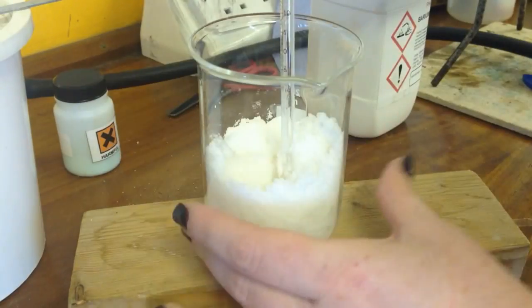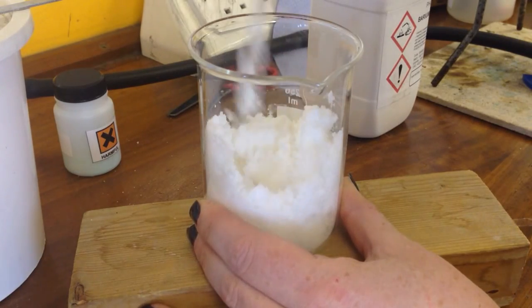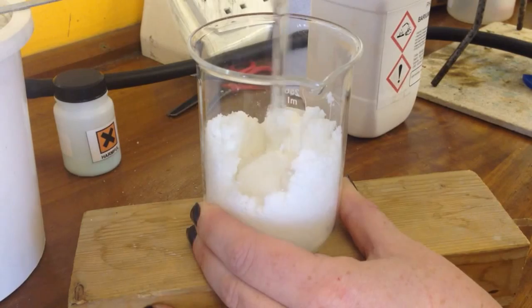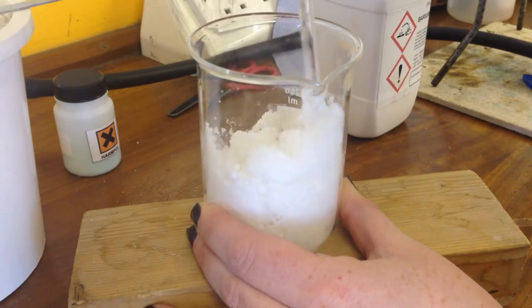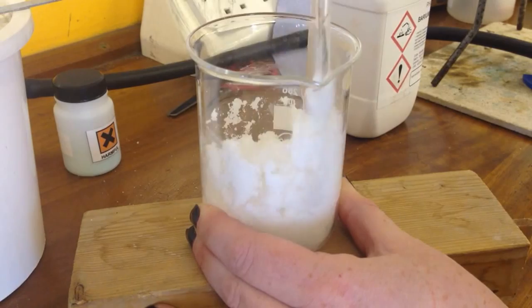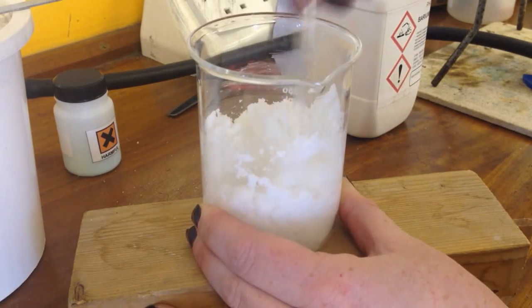I'm mixing these up. And if I feel it, it still feels room temperature. It doesn't really feel cold or anything. It just feels normal. And you can see, this is really smelly. And you can see these two are starting to come together now.